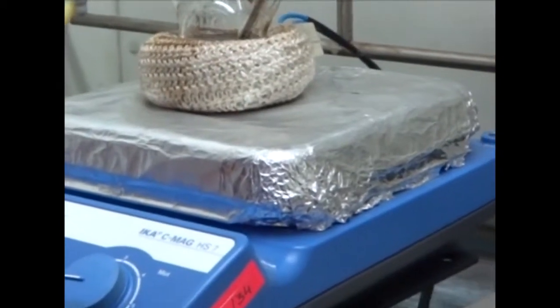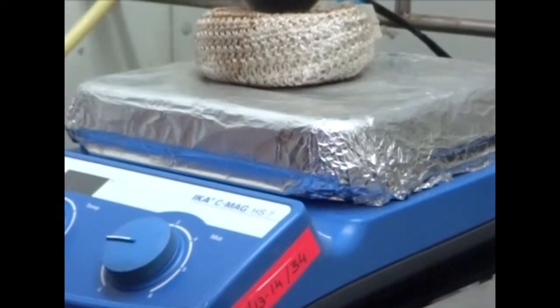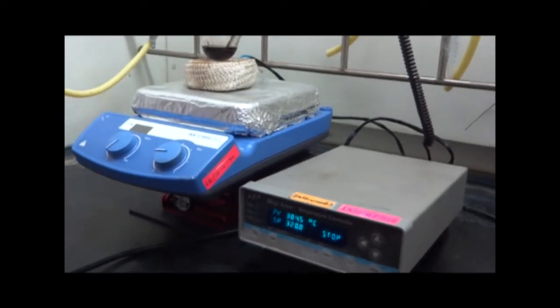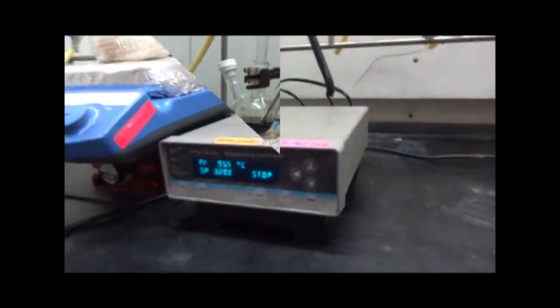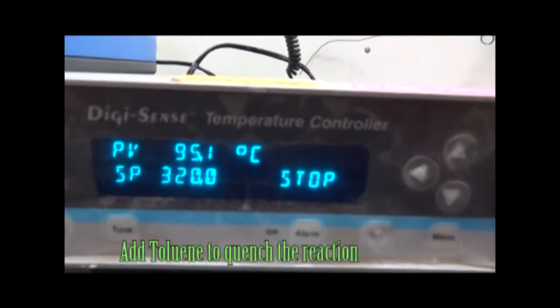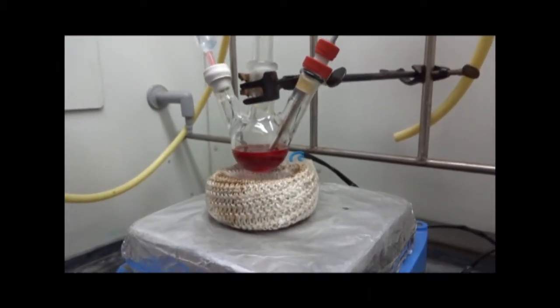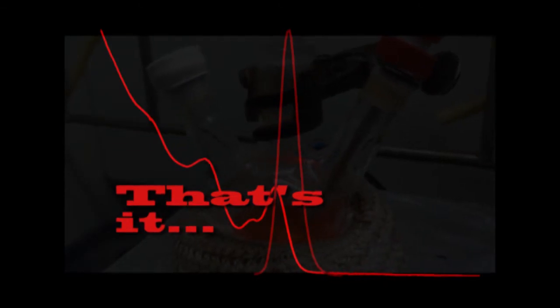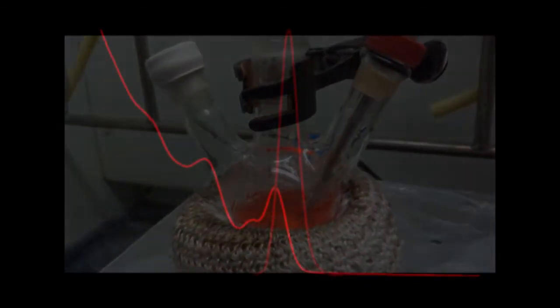Reaction is done, now stop heating and let it cool. At around 100 degrees centigrade, add toluene to quench the reaction. Hence, I have prepared good quality CdSe quantum dots, as reflected in the absorbance and photoluminescence measurements.